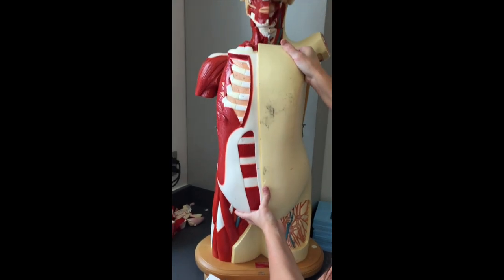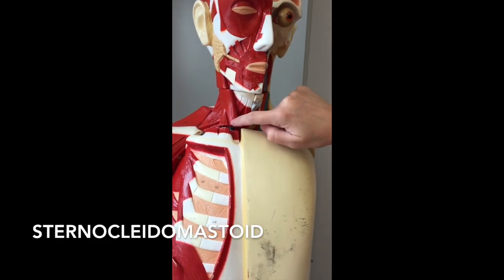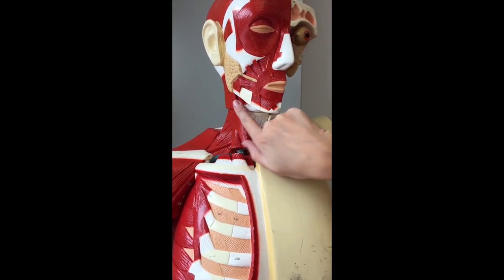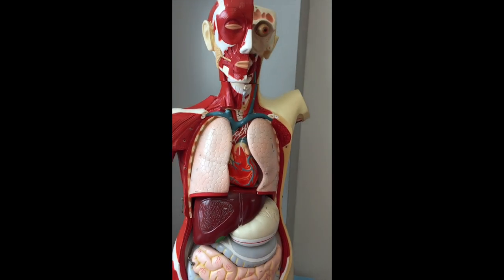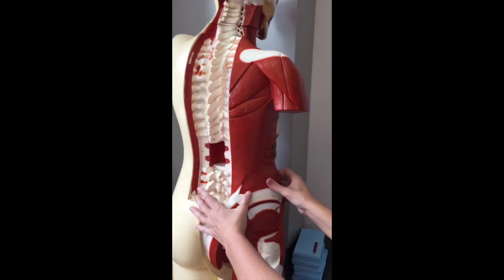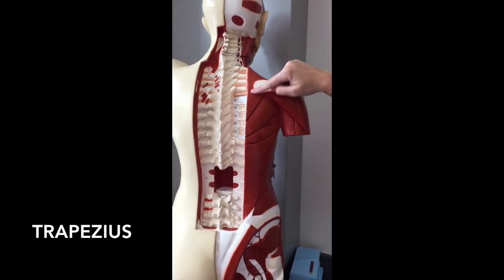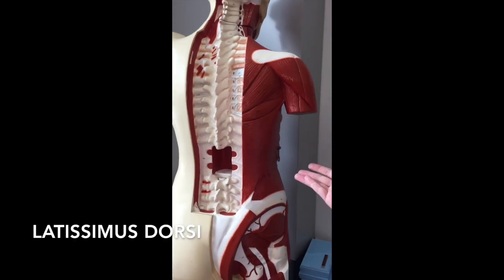If we hold it up to the actual body, we can still see the sternocleidomastoid — it's connecting the clavicle, the sternum, all the way up to the mastoid. So this is your sternocleidomastoid right about there. And that's it for the front of the body. We can see a little bit of trapezius muscle here and also the latissimus dorsi muscles here.